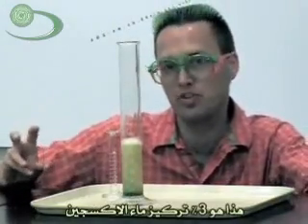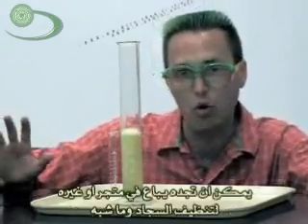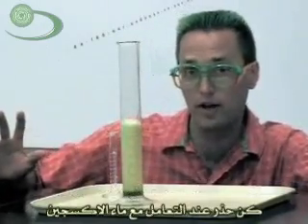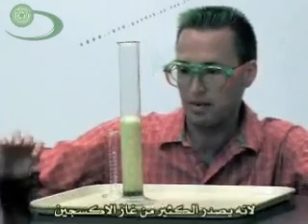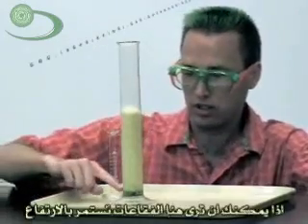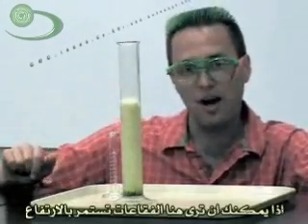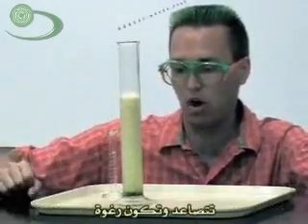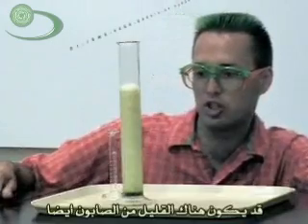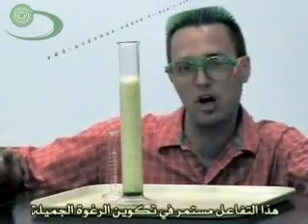Now this is 3% hydrogen peroxide — what you could buy at the store if you wanted to clean out a cut or something like that. Be careful with hydrogen peroxide because it gives off oxygen gas. You can see it's still bubbling off, oxygen gas is coming out in a little foam. I put a little bit of dish soap in there, and that's going to make this cool little foam. And it's still going.